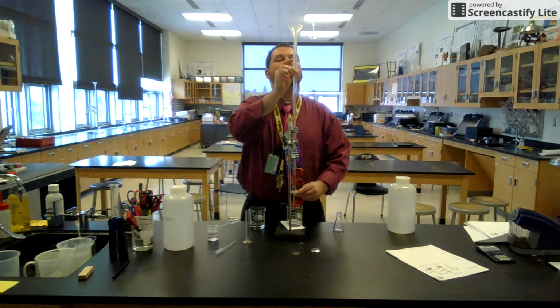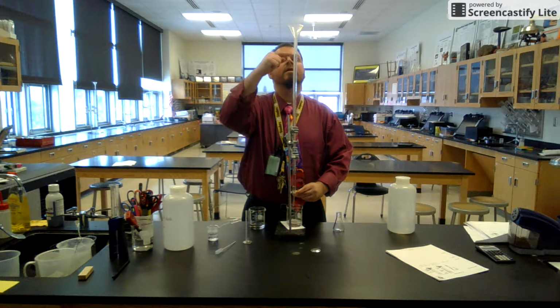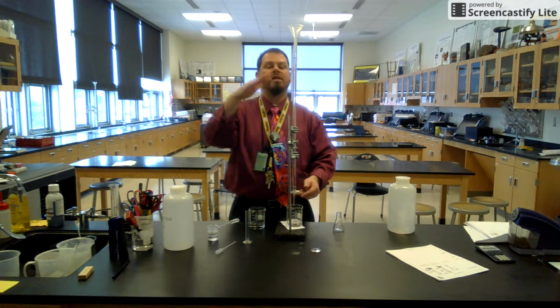Notice I am going to keep my eyes focused on this while I turn. I might not be dispensing any at all right now. I don't see it moving because I want to get that meniscus right to the line. Once I get it going at a slow rate, like it's going now, very slowly, I'm going to let it go. I'm not going to open it up anymore. I'm going to wait. It's getting there. Bam. Bottom of my meniscus is right at the 0 line.